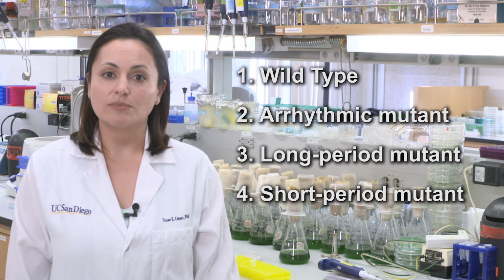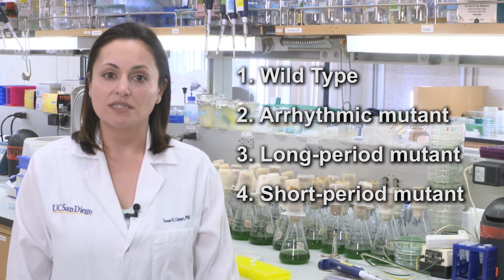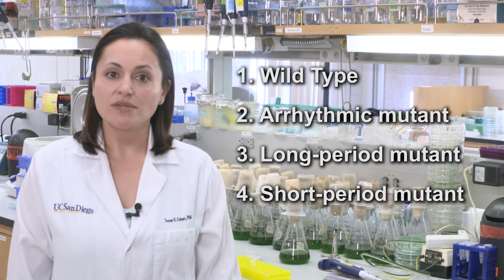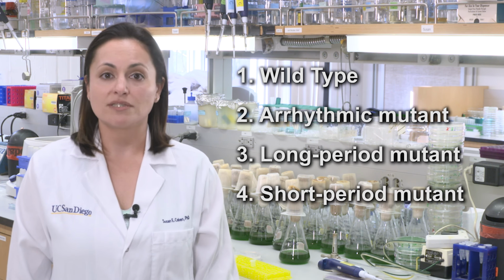Note that all of these samples came from the same S. elongatus species that had the luciferase-luciferin genes transformed. From this strain, other modifications to the clock genes were introduced, giving us the different mutants that we will observe today. When the reporter gene is expressed, we will be able to visualize expression by observing the amount of light produced by the cells. But first, we need to entrain the bacteria to a light-dark cycle so that all of the bacteria have their clocks set to the same time.